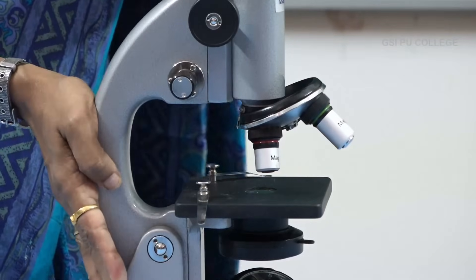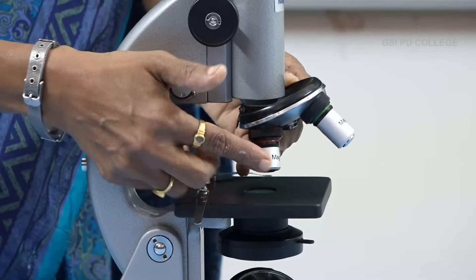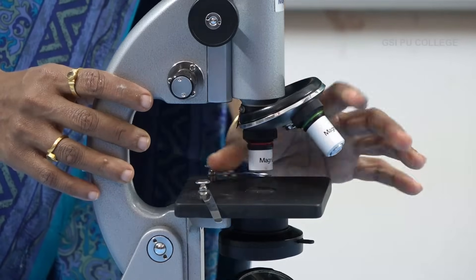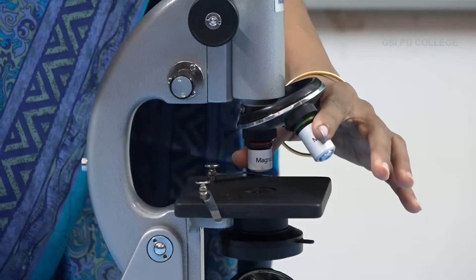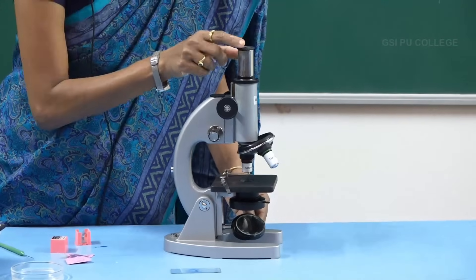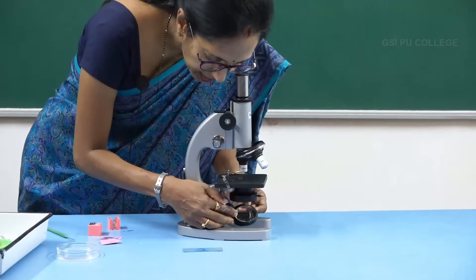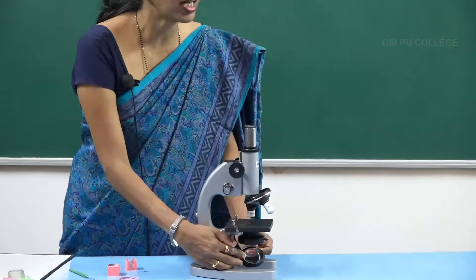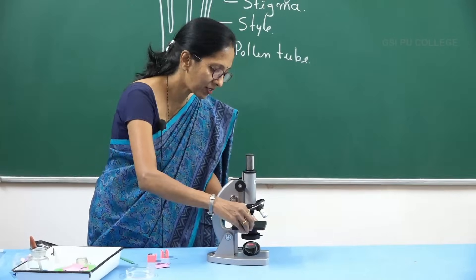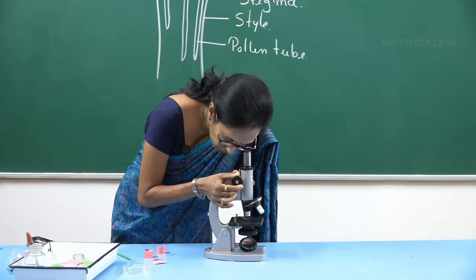This is the compound microscope. There are two objectives: the smaller one is the low power objective and the larger one is the high power objective. Use only the smaller one — you will hear a click which is the locking system. Put it under low power first. Focus the mirror towards the light, which may be artificial or natural. Then place the slide and slowly use the coarse adjustment.